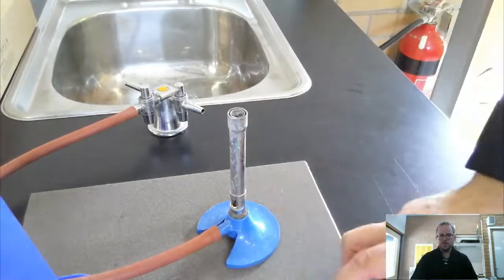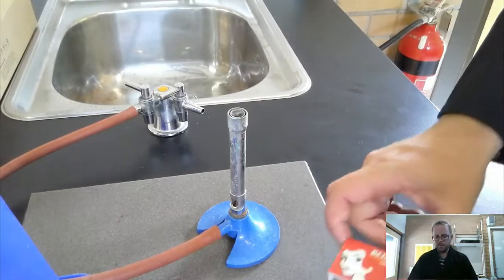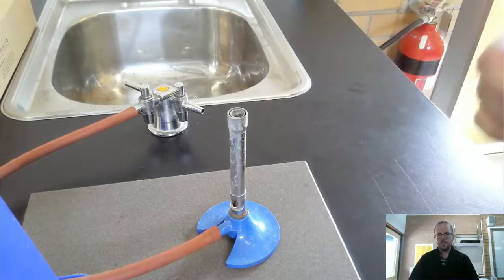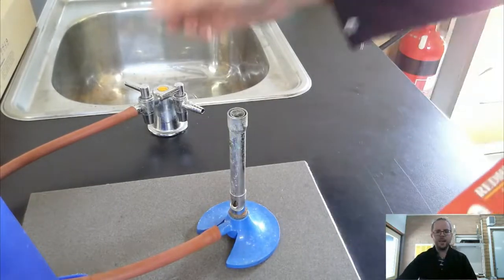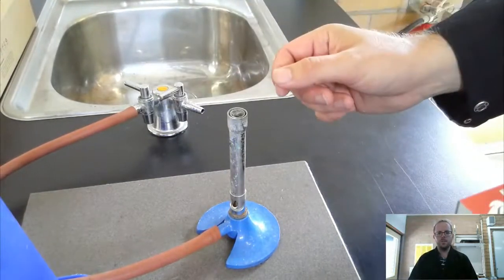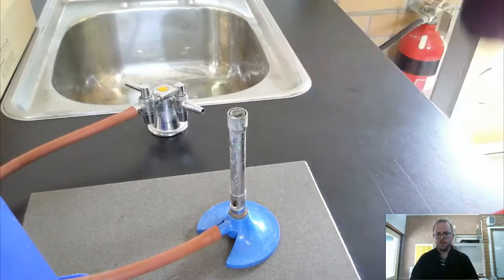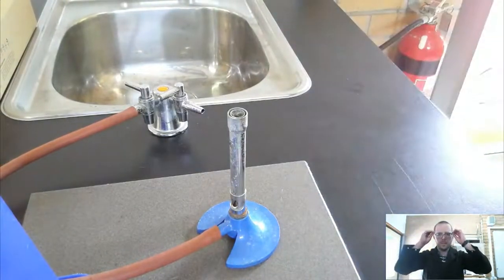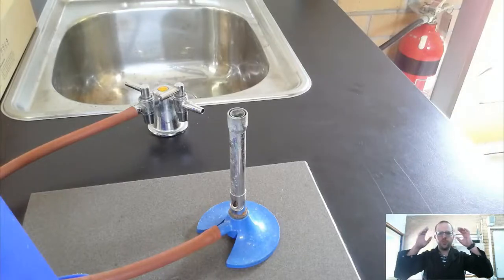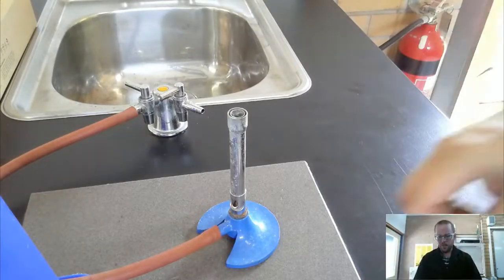So what I'm going to do in a moment when I'm going to light the Bunsen burner, I'm going to be lighting the match, and then I'm going to be turning the gas on, and then lighting the burner itself. But the first thing that I have to do, step one, safety here, safety glasses, and making sure that we're all safe and ready to go.